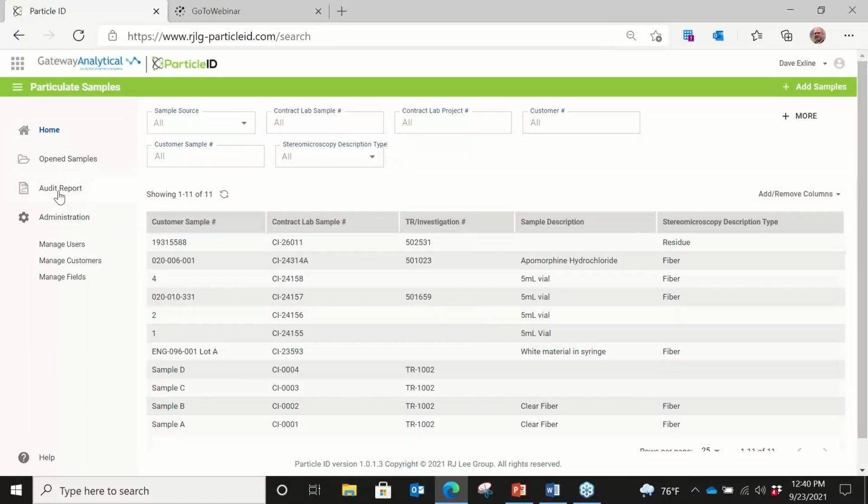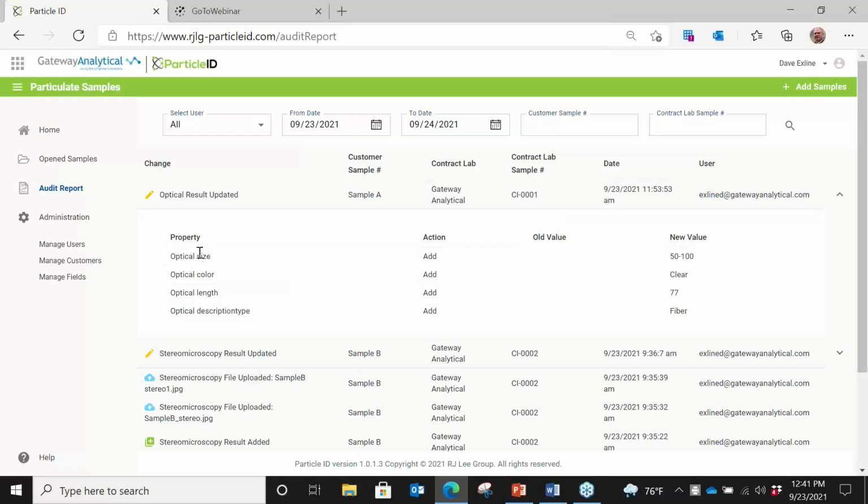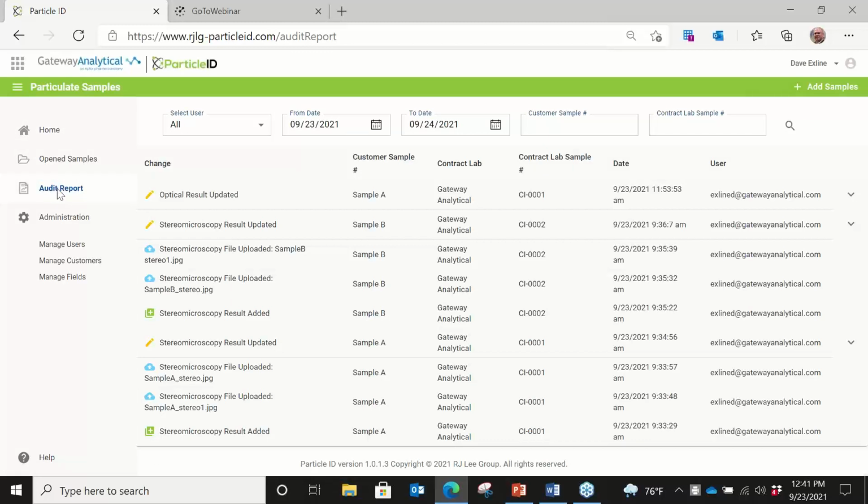So let's go back over to the audit report, for example. This morning I put a few things in, but simply every time something happens within the database, there is an entry. So in this particular example, we added optical size, optical color, length, and optical description type was all classified. As we look through those, it does an audit report. And as you might expect from an FDA requirement, they don't want just the zeros and ones and not be able to view the information. This allows us to create an audit report for every sample. We can put a sample number in, we can put a lab number in, and then we can have dates between what they were doing and have all the information to follow up.